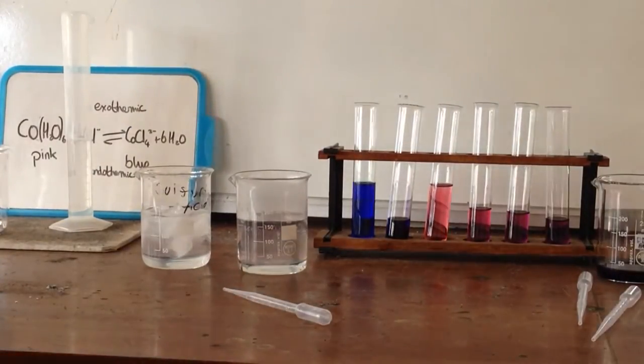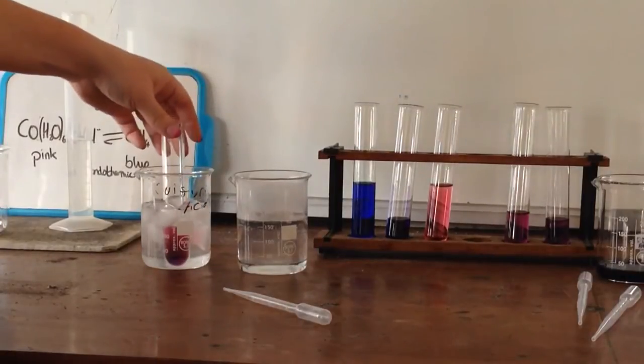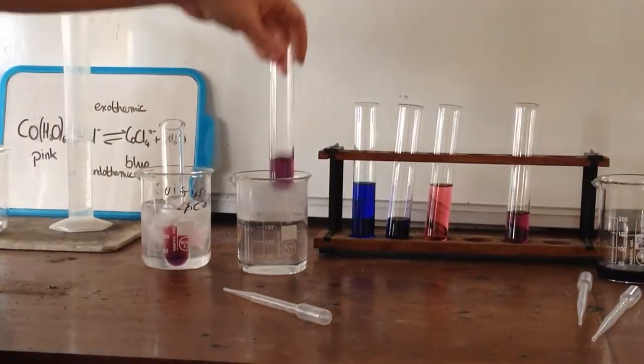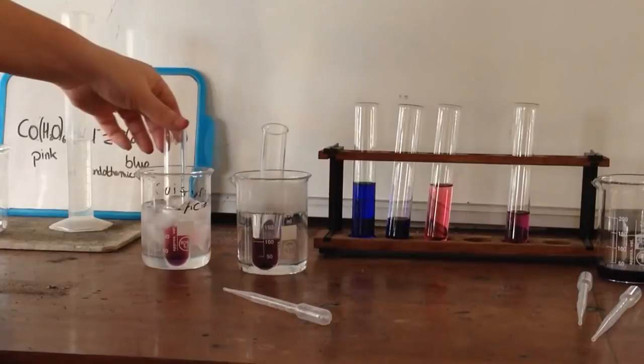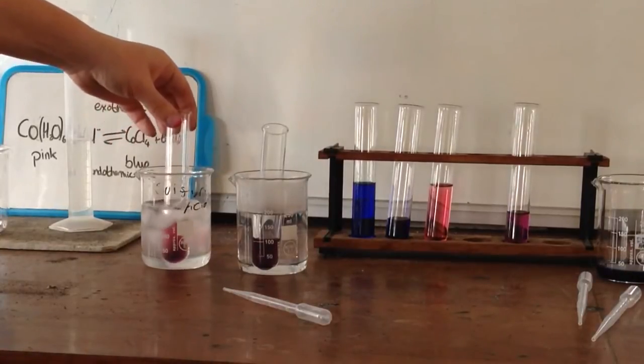I'm going to add one of them into ice, one of them into hot water, and we should see a color change taking place.